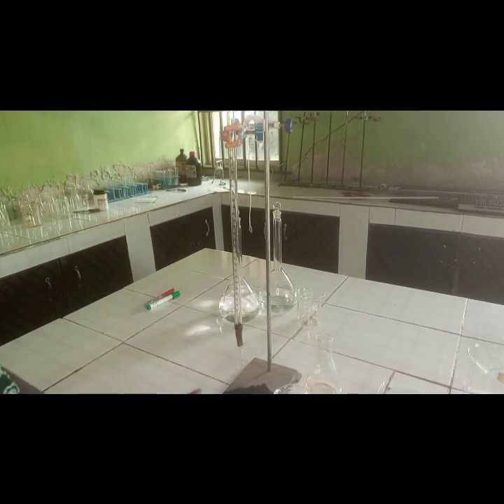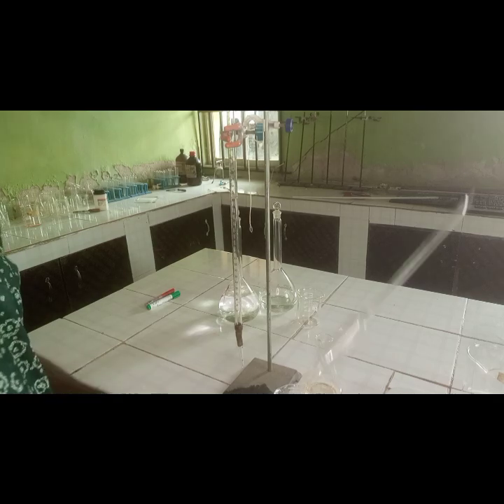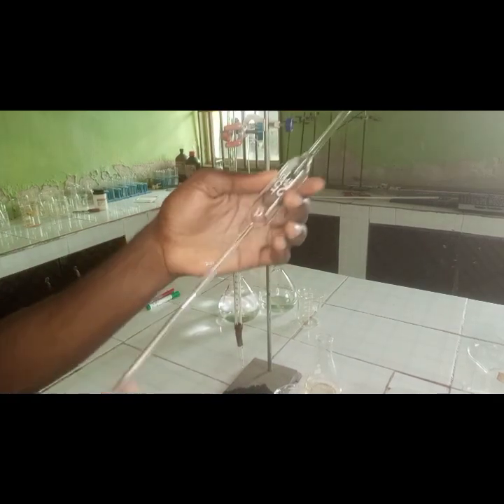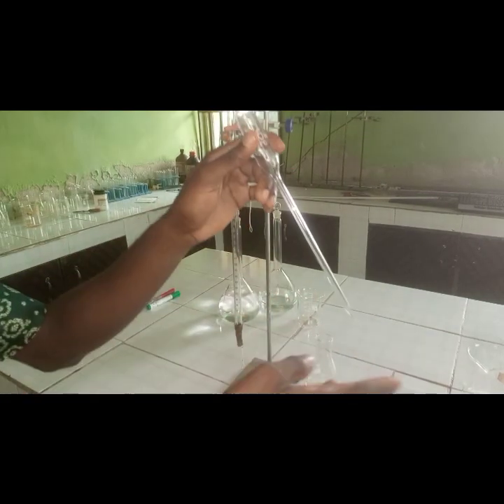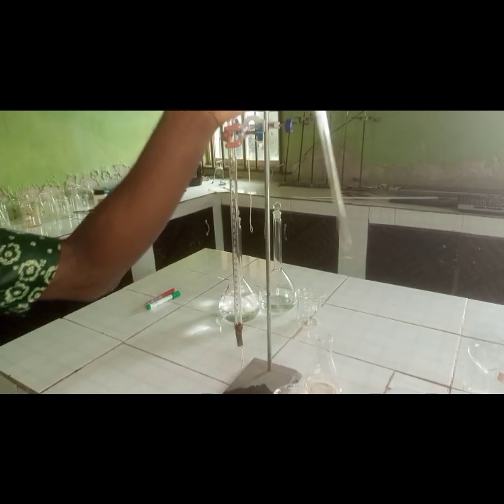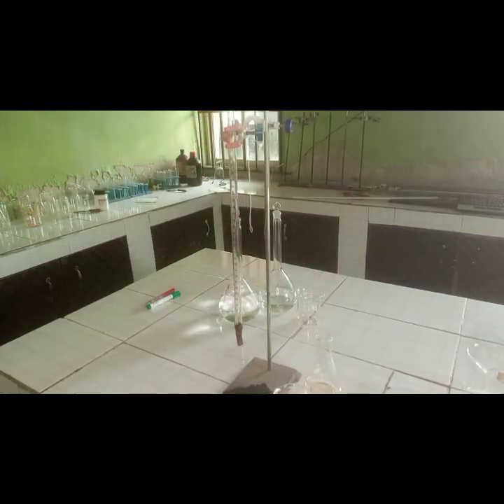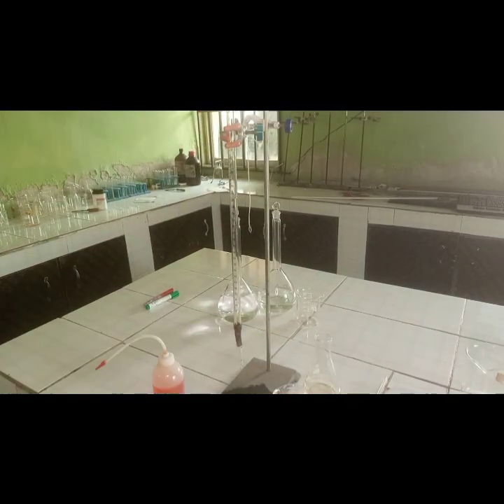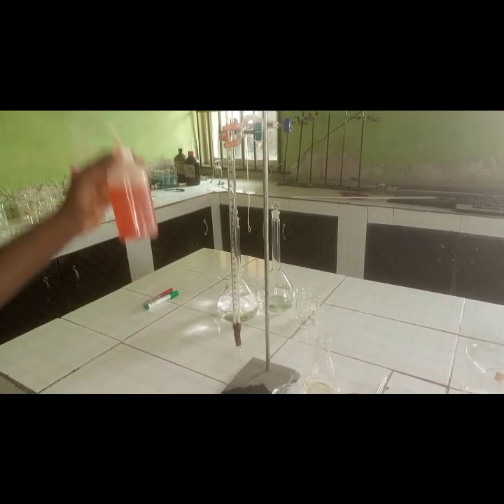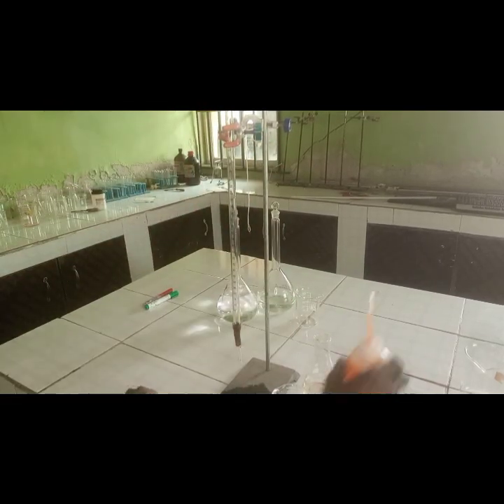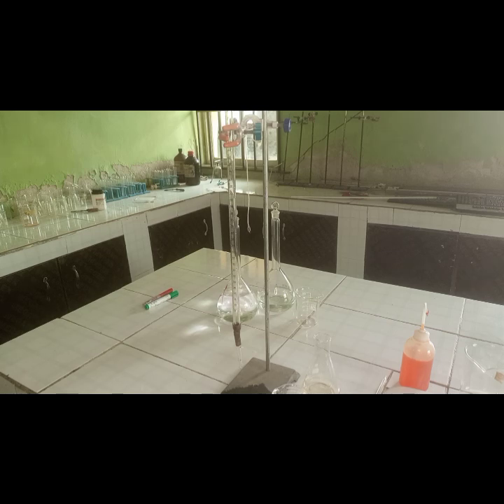Other precautions is that when you completely discharge the content of this, you don't blow to remove them all because it is designed to discharge exactly the volume it's supposed to be. So methyl orange indicator is the best type of indicator used for this experiment because the acid is a strong acid and the base is a weak base.